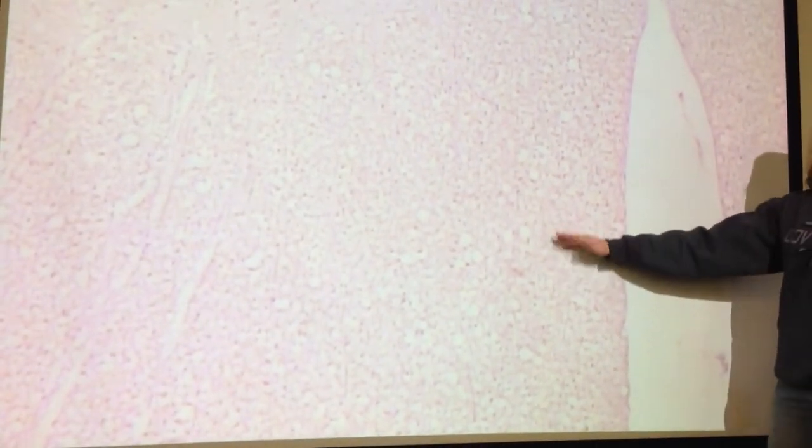That's another important differentiation because some of the slides that you get aren't going to have really great anterior median sulcuses like this one, or fissures like this one does. So if you can't really tell using that strategy, try to figure out which horn goes all the way to the edge. And that's another way you can tell which side's anterior and posterior. So I'll show the horns a little bit better for this one. So in this view, see the nice big fissure, so we know it's the anterior side. So on either side of it, we'll have ventral horns.